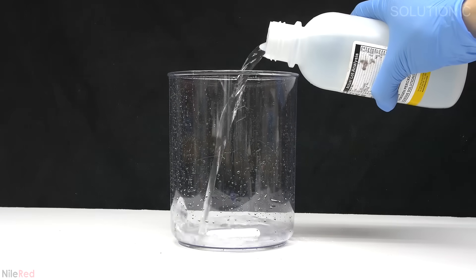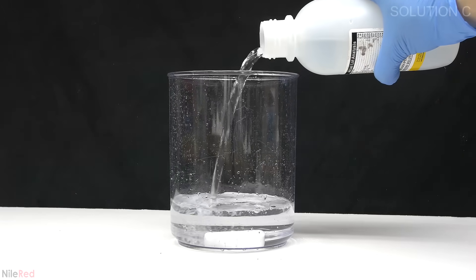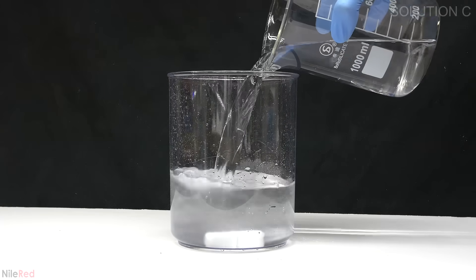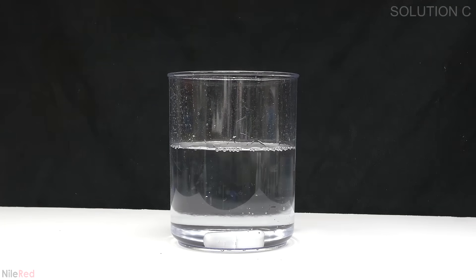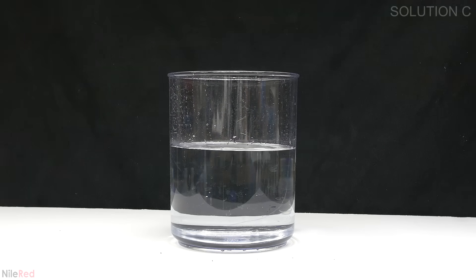Into a freshly cleaned container I add about 400 milliliters of 30% hydrogen peroxide. On top of this I pour in 600 milliliters of distilled water to give a total volume of 1 liter. I turn on the stirring and I stir it for something like 30 seconds. The stir bar is removed and then everything's labeled with the letter C.